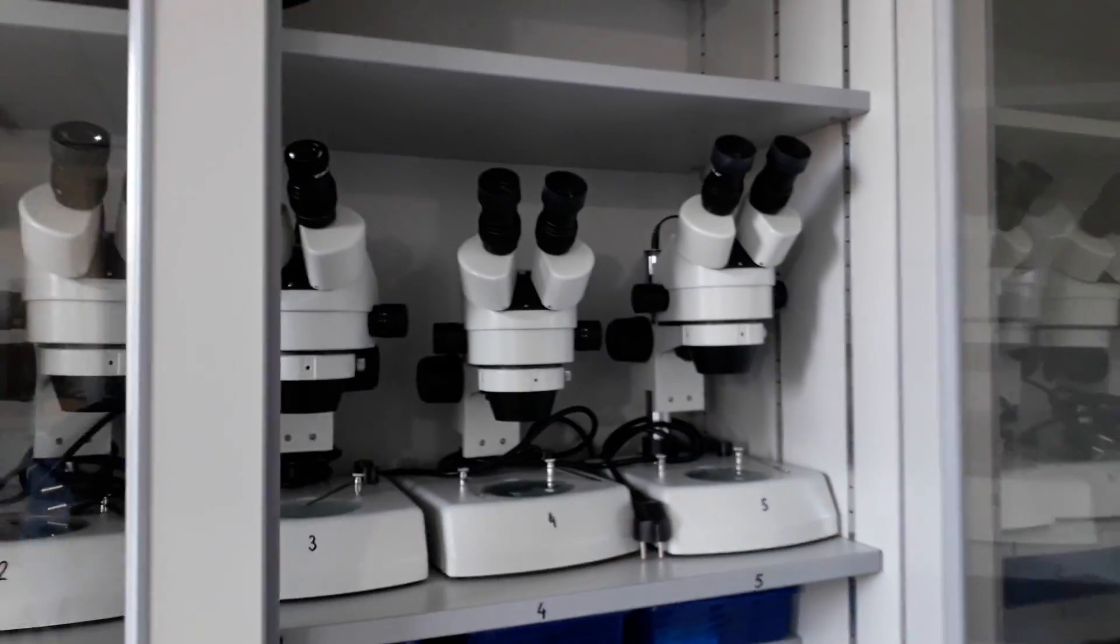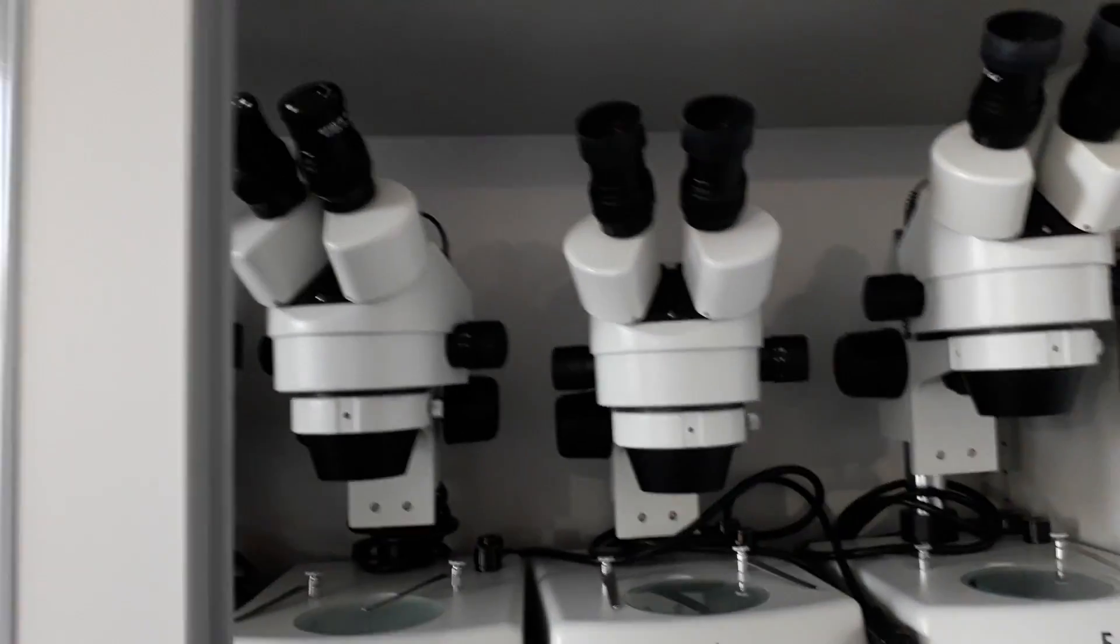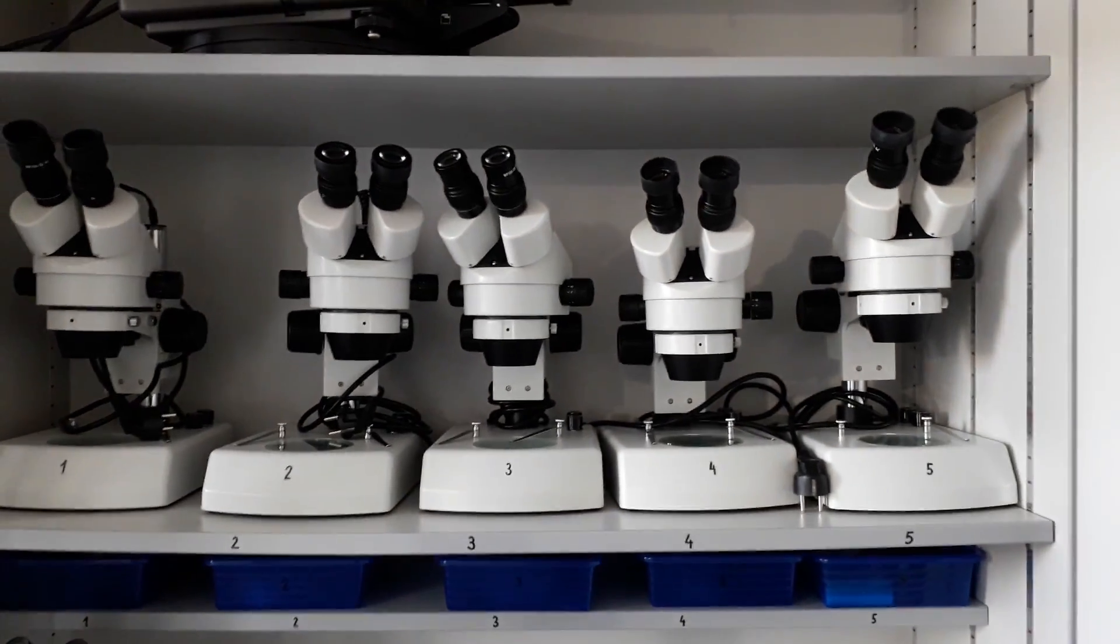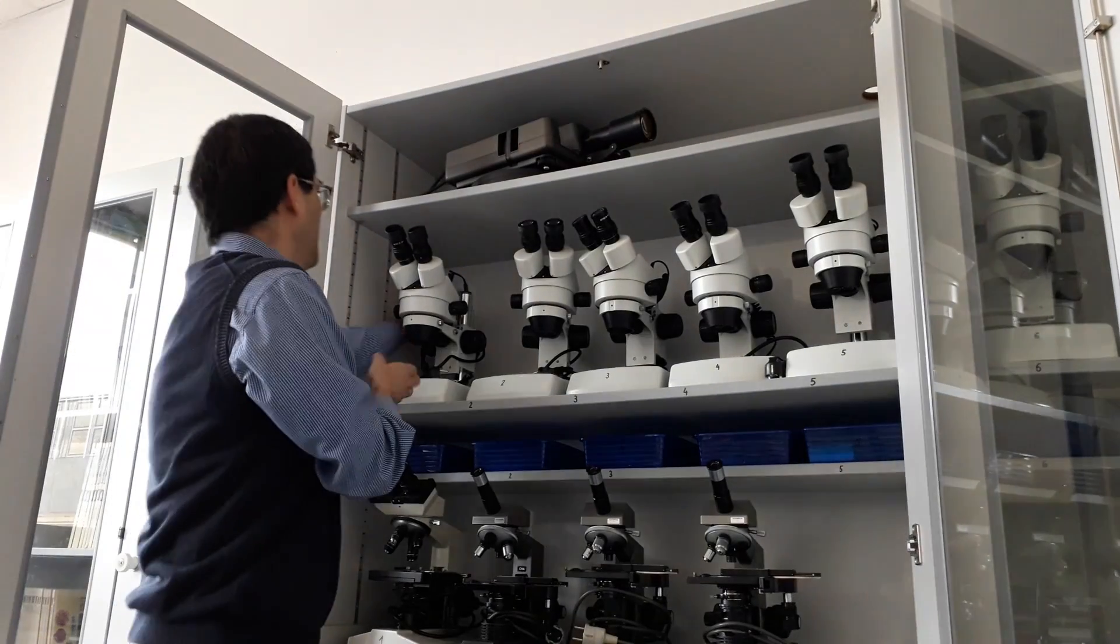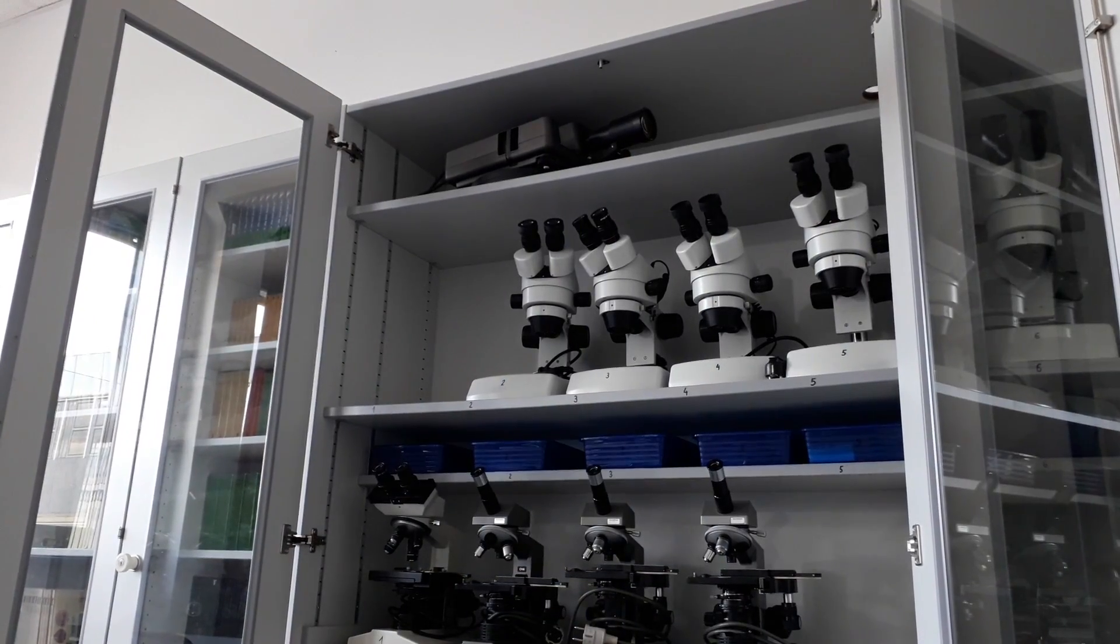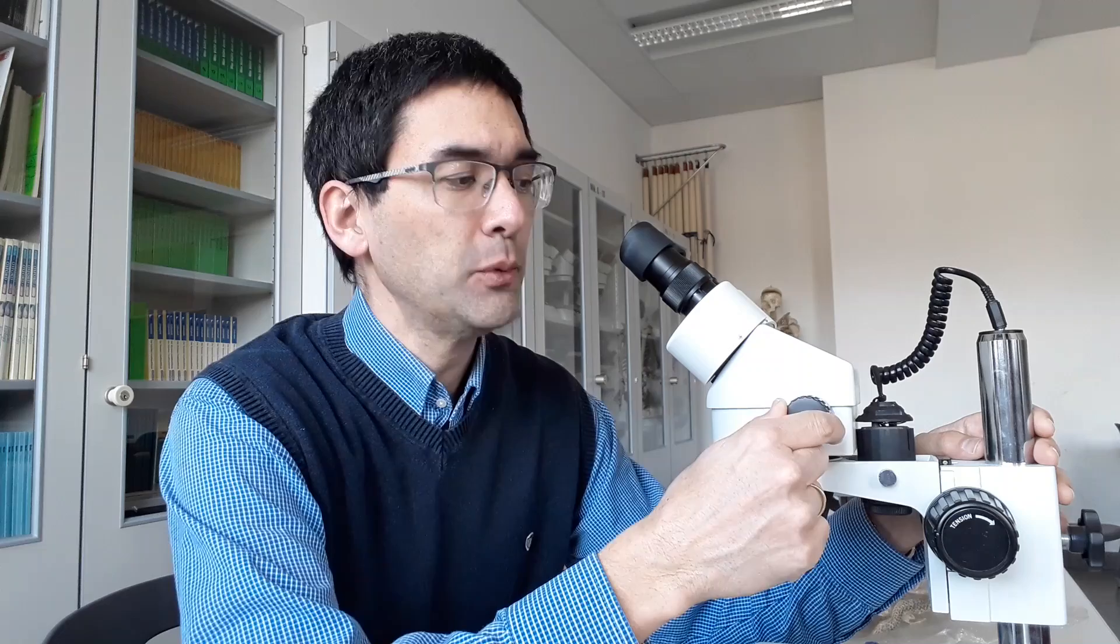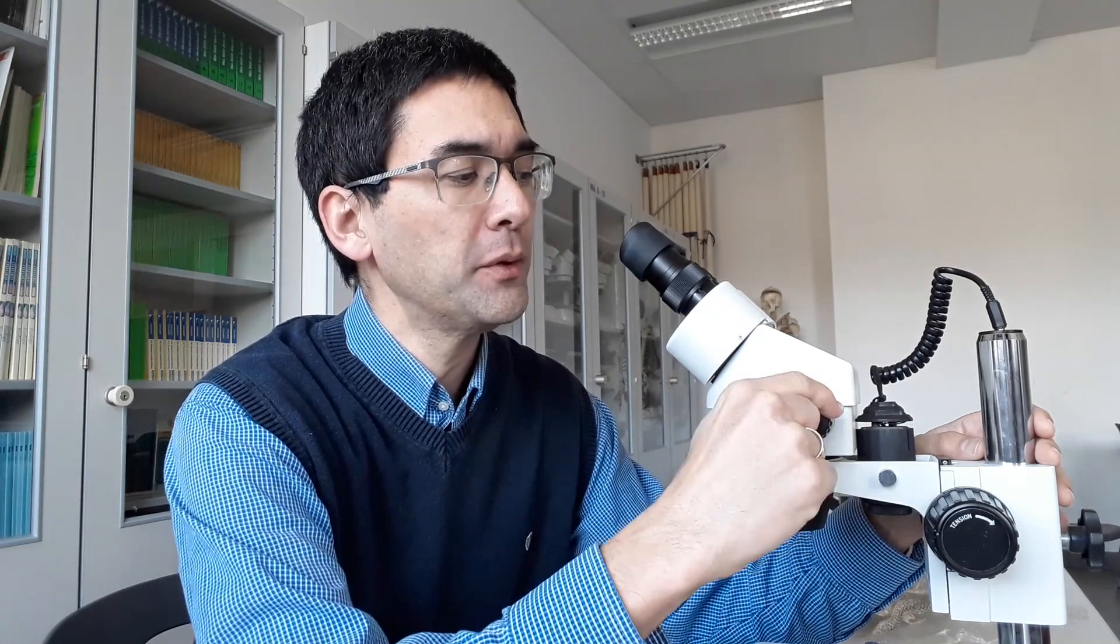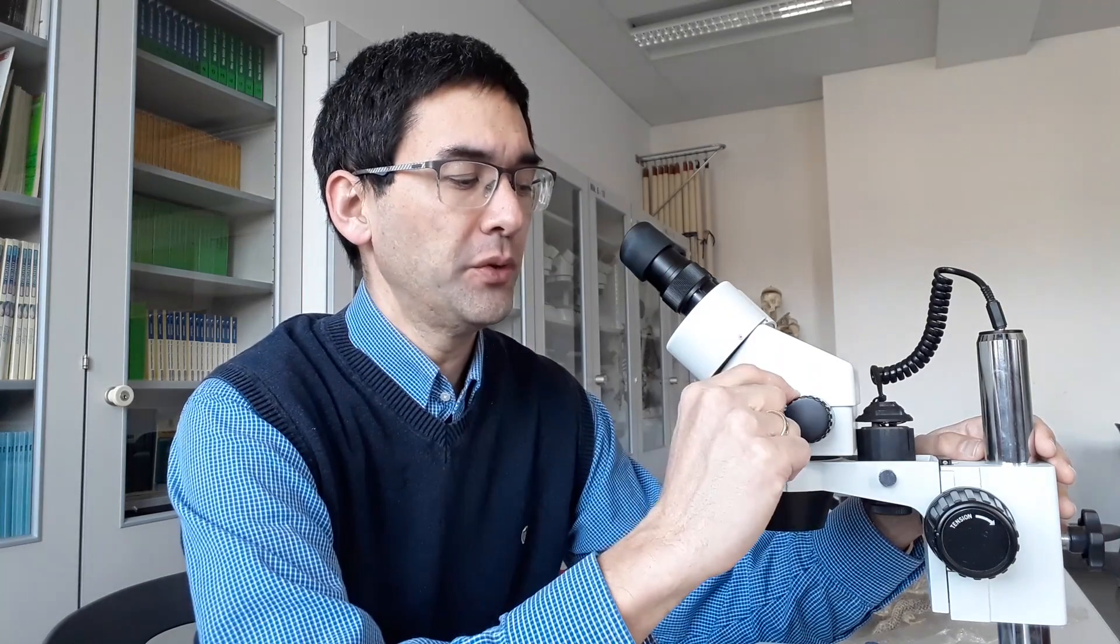I'm now taking out one of the stereo microscopes that we use. It's a pretty good stereo microscope with a zoom function - not many have that. This microscope can magnify from seven times all the way up to forty-five times, so this is actually a very good microscope.